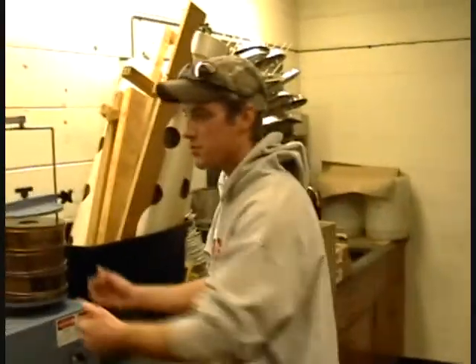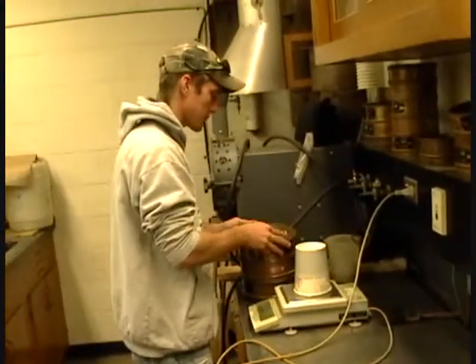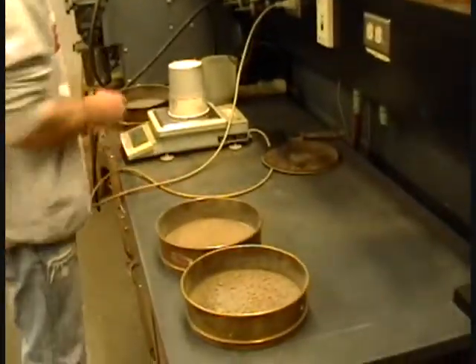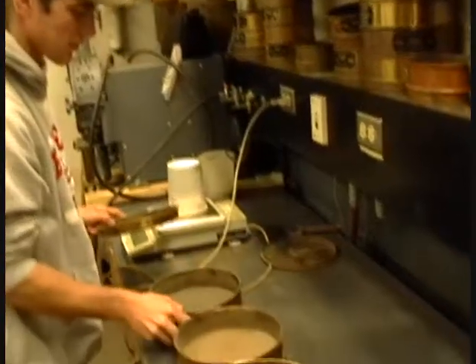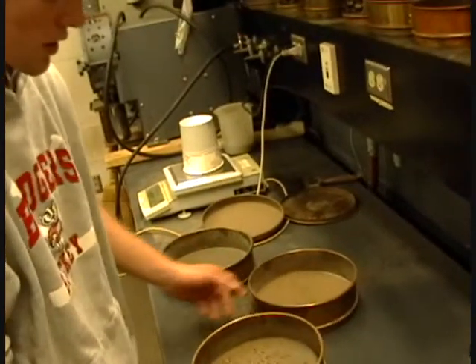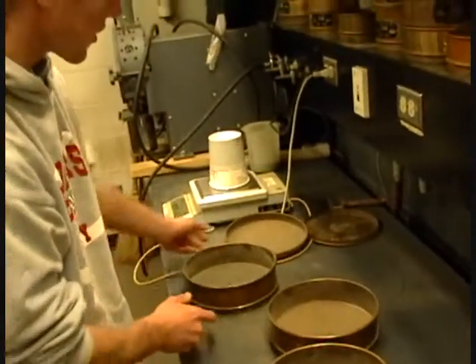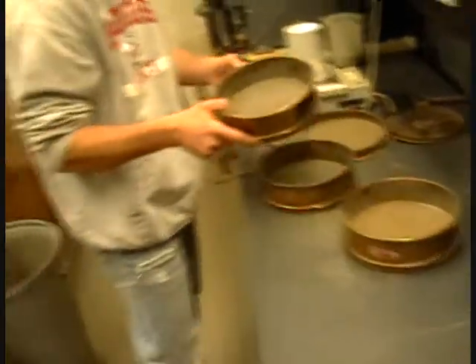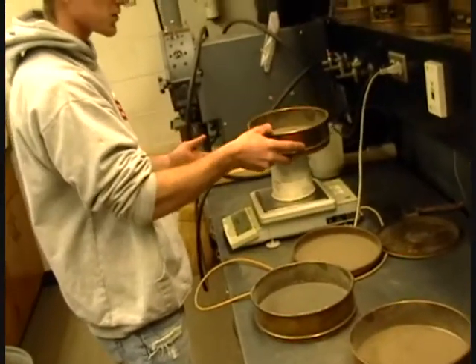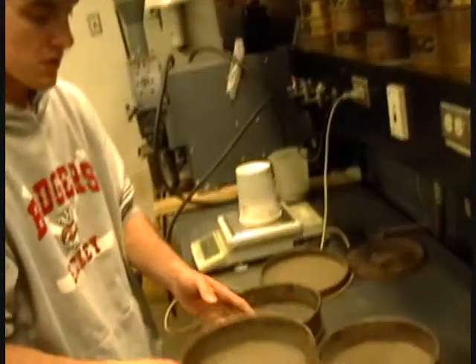Okay, after 3 minutes of sieving, it's time to pull the pans off the sieving machine and take their mass samples. Each sieve has soil within. As you can see, the bigger sieve has the bigger sands and so forth down to your catch-all. You're going to take the pans, and since we know the original pan weight without the soil, we can weigh the pans with the soil and get the difference weight for each sand fraction size.